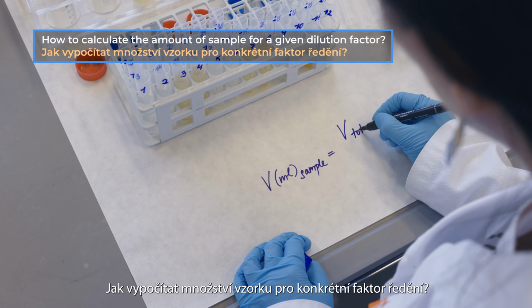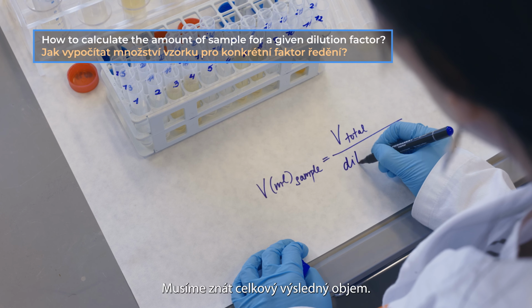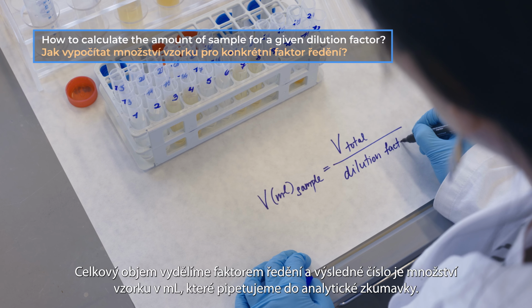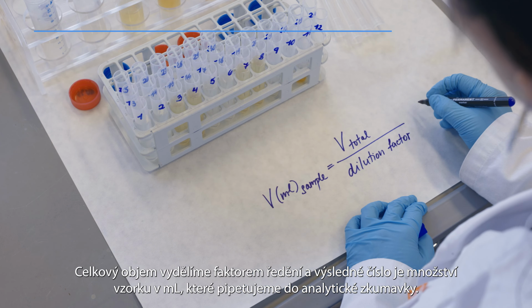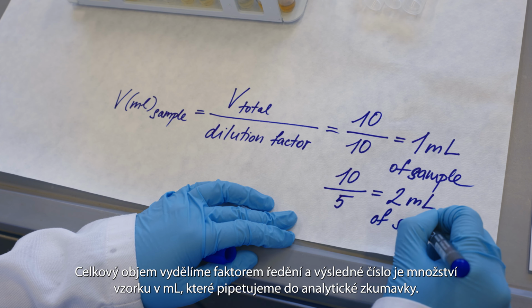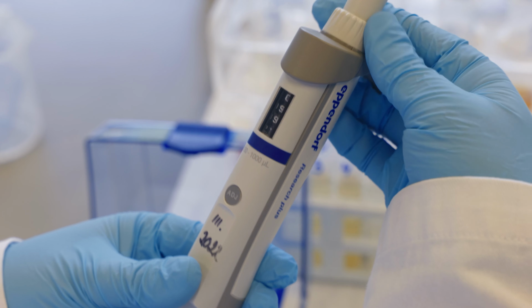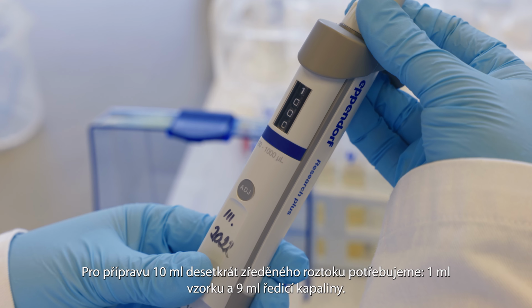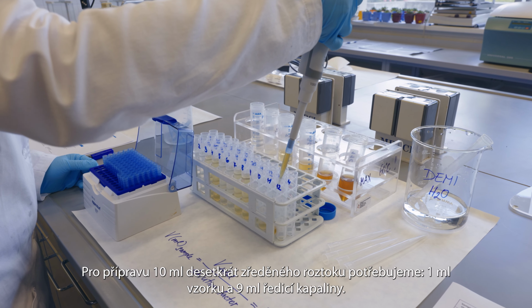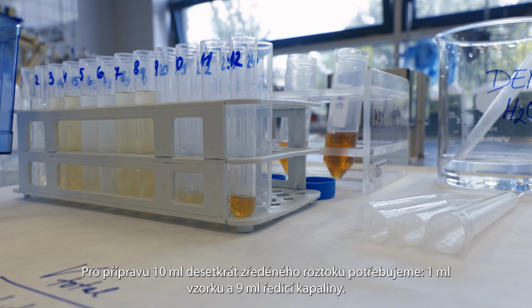How to calculate the amount of sample for a given dilution factor? We need to know the final total volume. Divide the final volume by the dilution factor and the resulting number is the amount of sample in milliliters that we pipette into the tube. For the preparation of 10 milliliters of 10 times diluted solution, we need 1 milliliter of sample and 9 milliliters of dilution liquid.